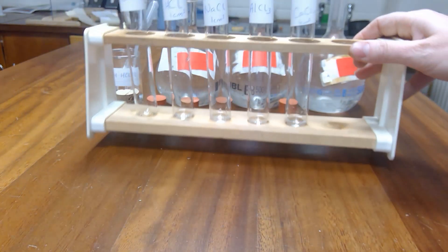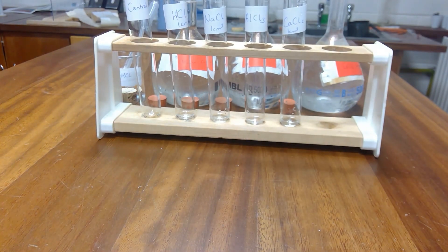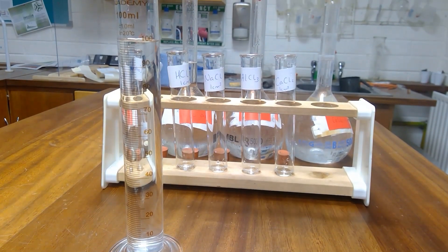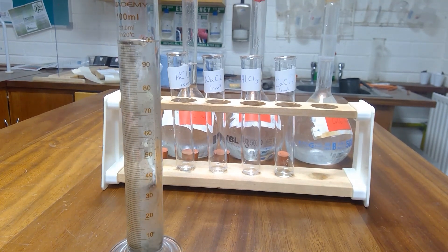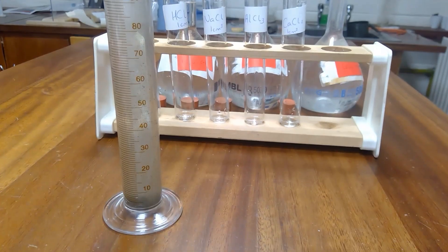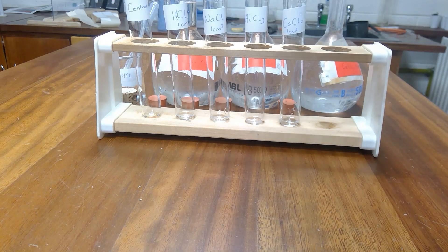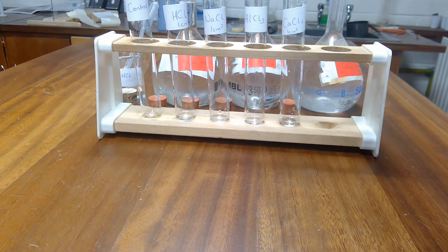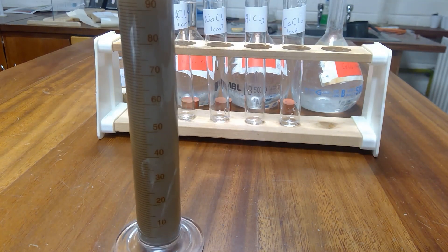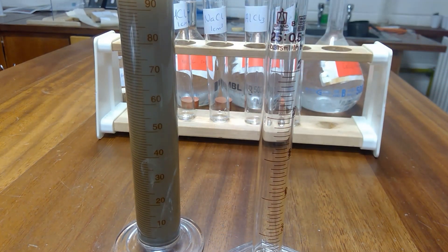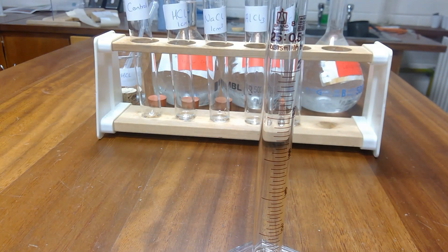So what do I do first? Once I have everything set up, I take my 100 centimetres cubed of water and deionised water. And I'm going to add in my 1 gram of clay soil. Okay, and I'm just going to shake it and invert it. And this is what I get. Now, I'm just going to go down to eye level. And I'm going to measure out 10 centimetres cubed of this.